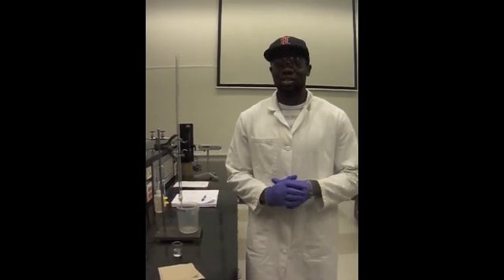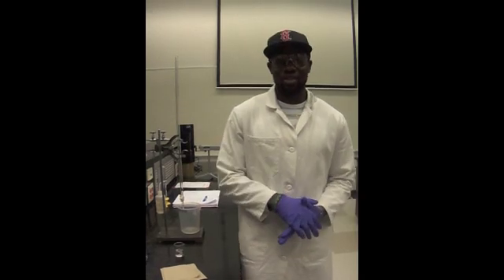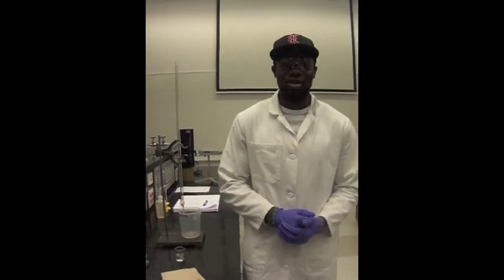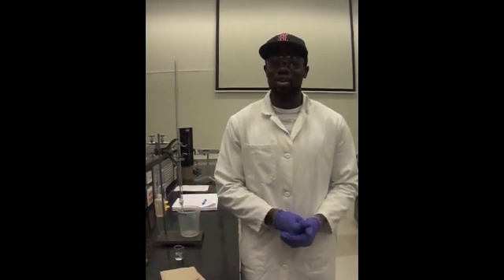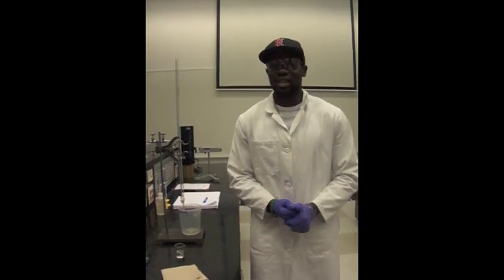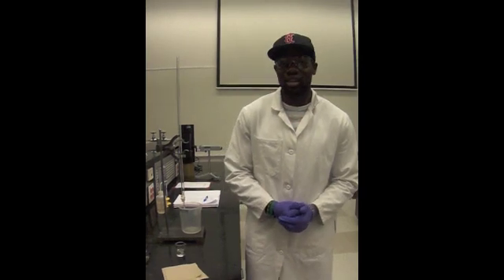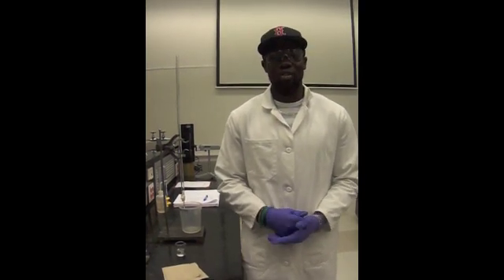Today I'm going to be going through a vinegar titration lab with you. If you've made it this far, I want to congratulate you because this is one of the labs that's later on, and that means you're passing so far. The objective of this lab is to find out the acetic acid concentration in vinegar, which is usually around 5%.